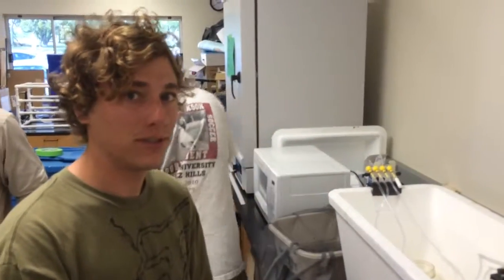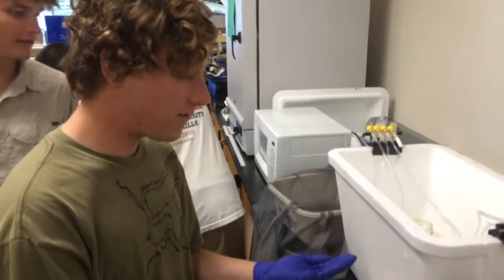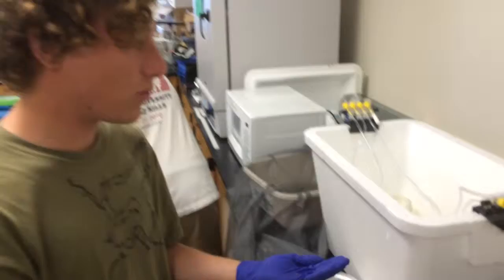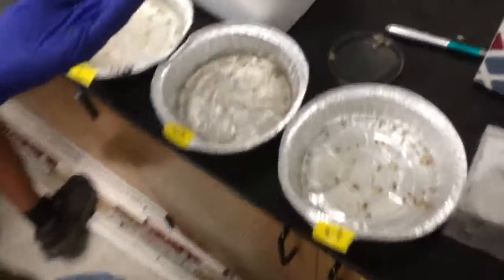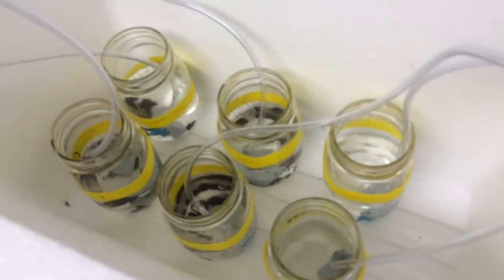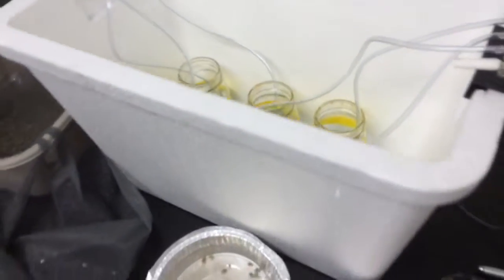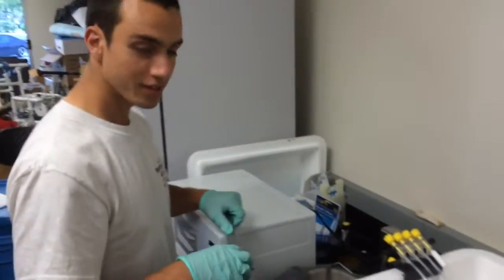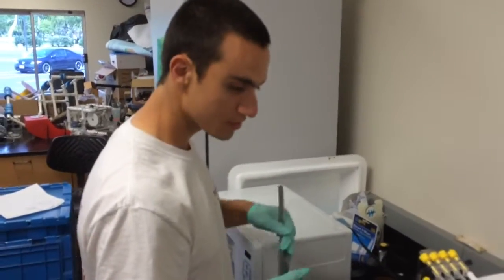Sand crabs. We're measuring them out into different sizes and then we'll be putting them into different test sizes. Edgar, what are you doing? Same thing? Yep, measuring crabs.